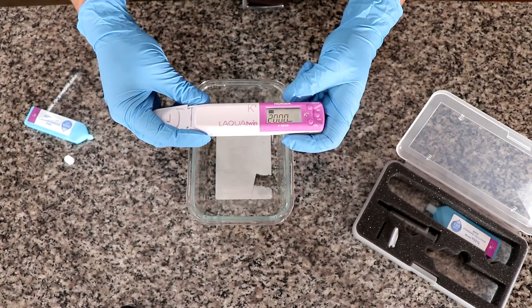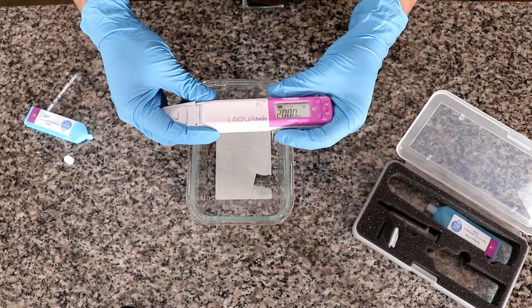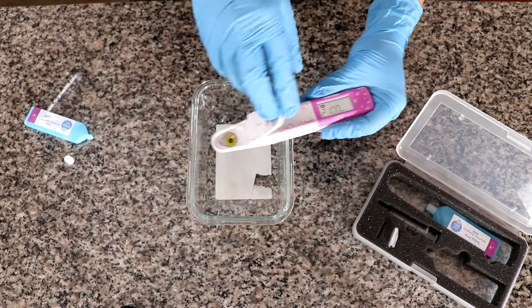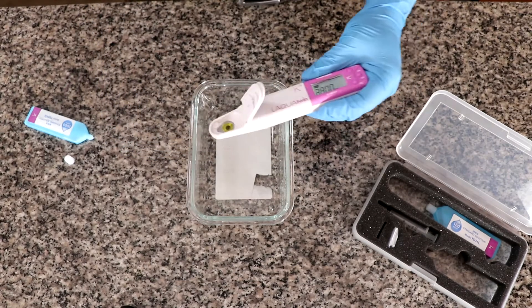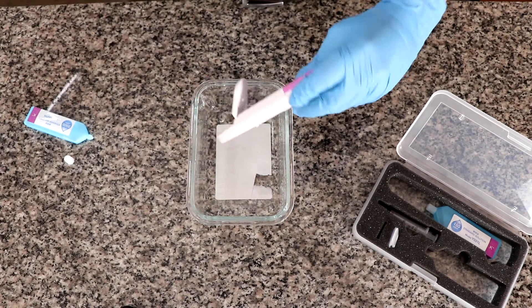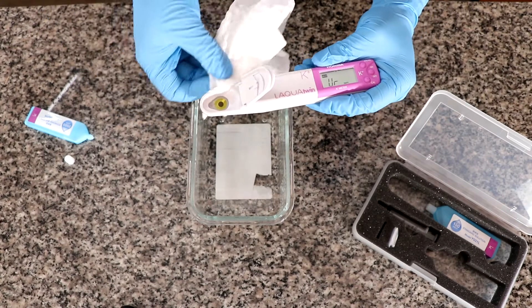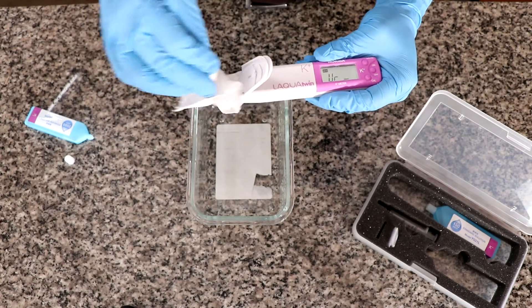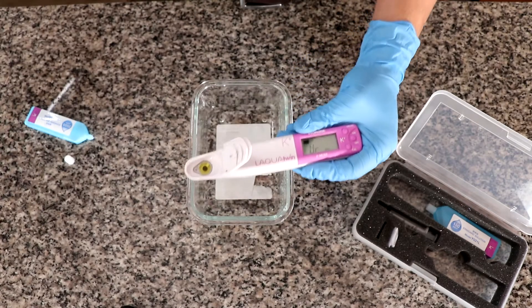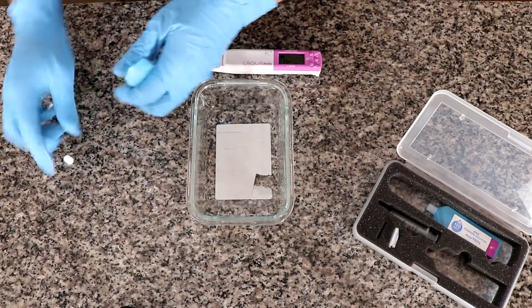And now we need to wait till there's a happy face again. There. So now the calibration process has been fully completed with the two solutions. It's important to do the two point calibration to maximize the accuracy and to perform it as I showed you where you clean and then you purge so that you can get the maximum possible effectiveness.